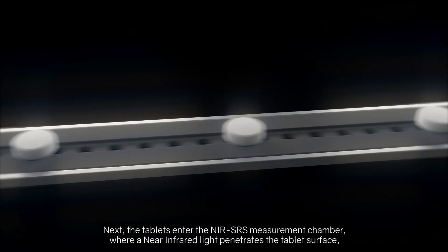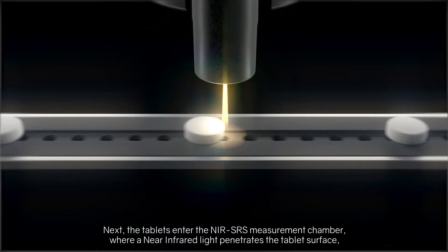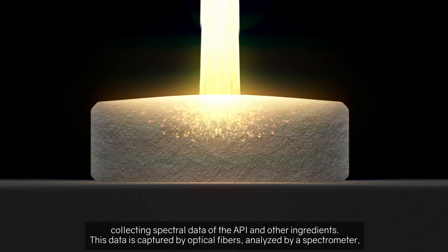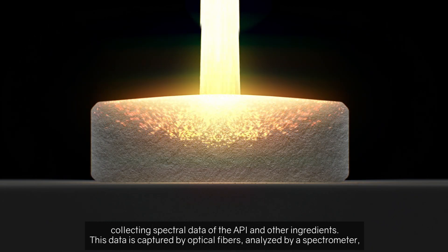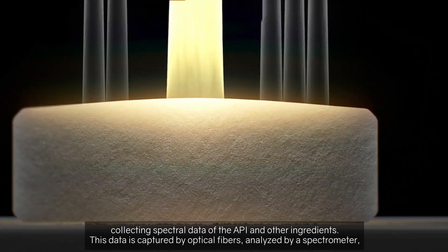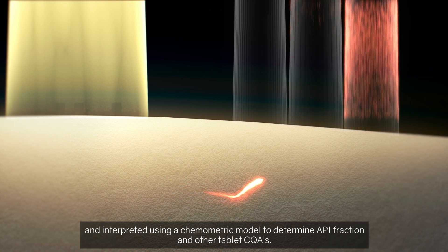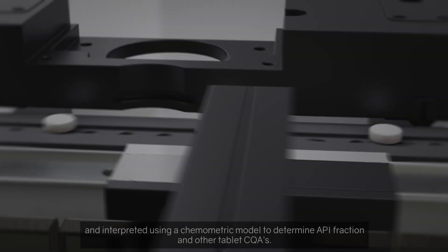Next, the tablets enter the NIR-SRS measurement chamber, where near-infrared light penetrates the tablet surface, collecting spectral data of the API and other ingredients. This data is captured by optical fibers, analyzed by a spectrometer, and interpreted using a chemometric model to determine API fraction and other tablet CQAs.